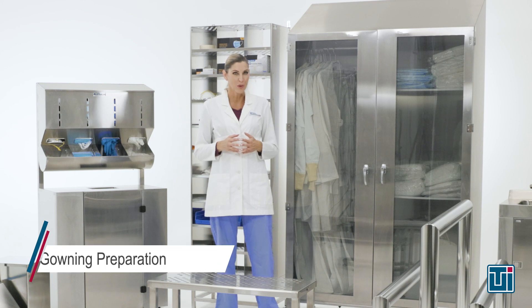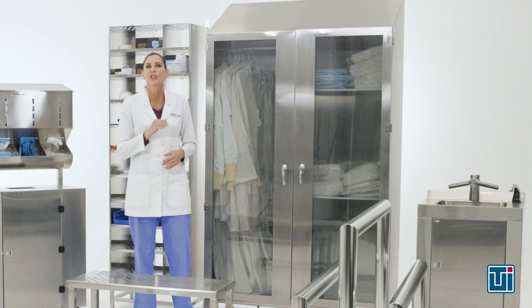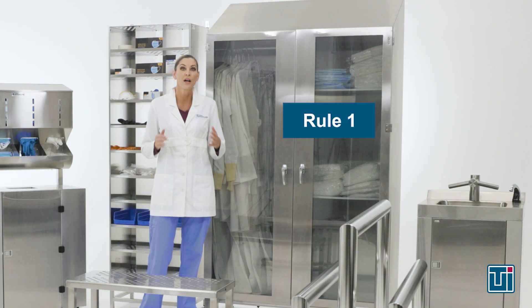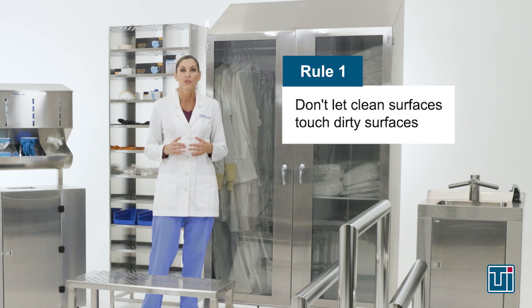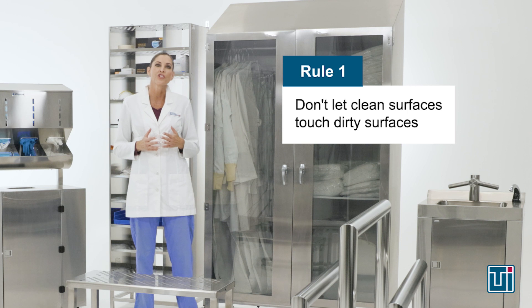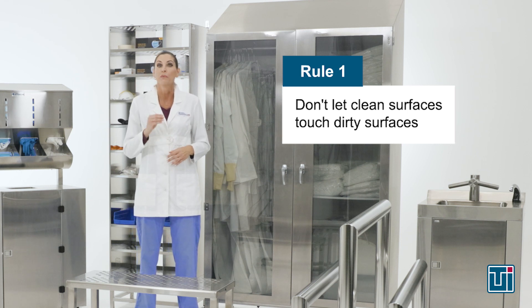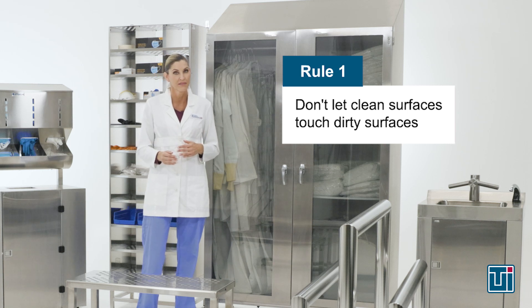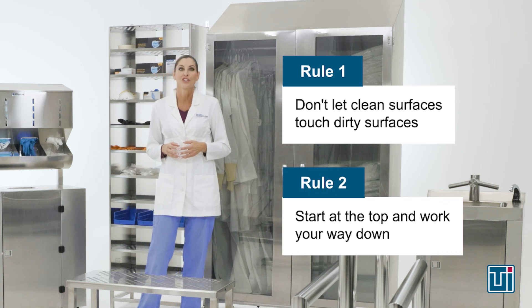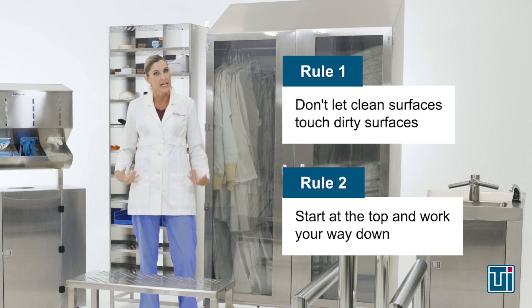Before we begin, let's look at the two most important principles for preventing contamination during the gowning process. First, you should never let clean surfaces come in contact with dirty ones. This means never touching clean garments or materials until you've washed your hands thoroughly and donned clean gloves. You must keep garments away from the floor and other dirty surfaces. Second, as you proceed through the gowning process, you must start at the top and work your way down.